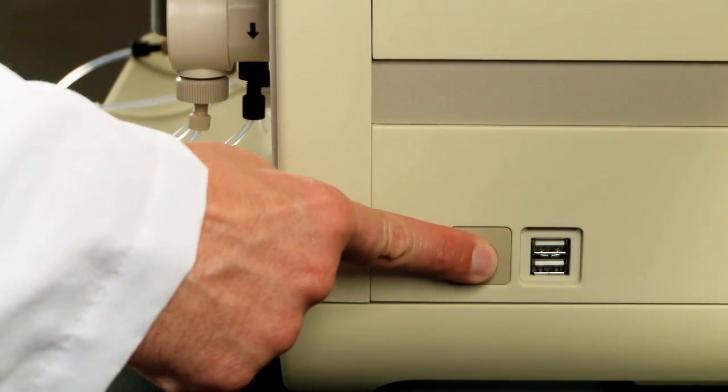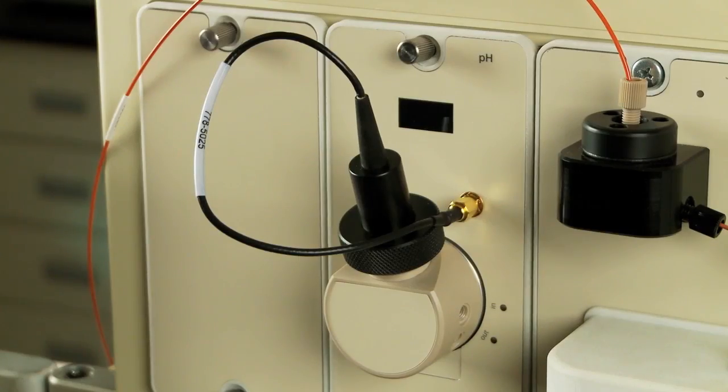Power on the NGC instrument. The pH valve LEDs turn on, indicating proper installation and recognition of the module.